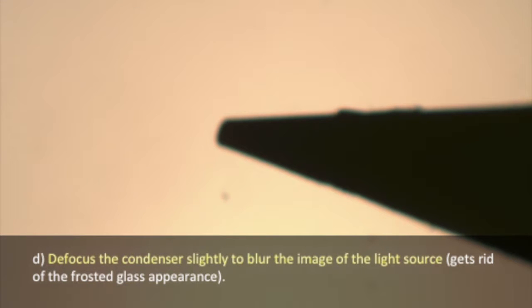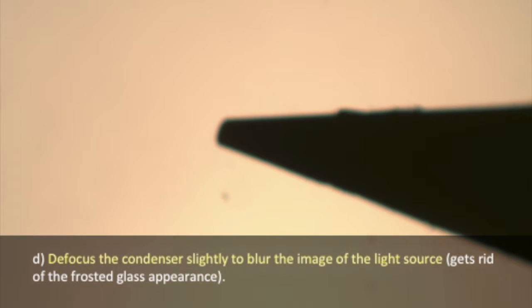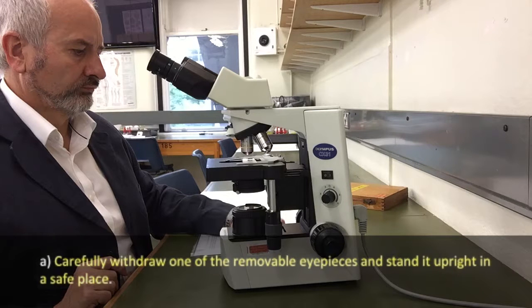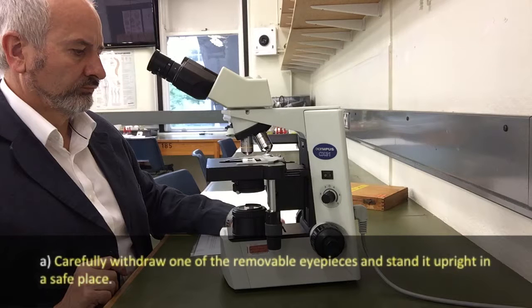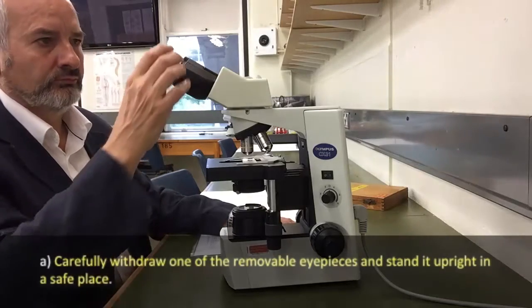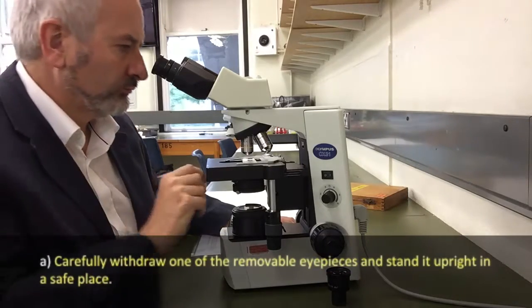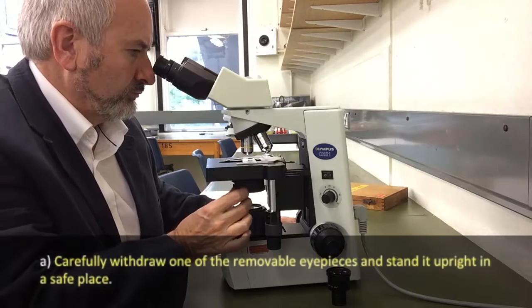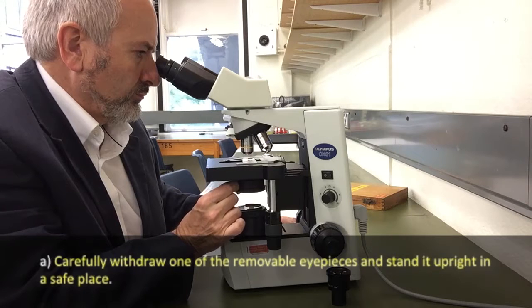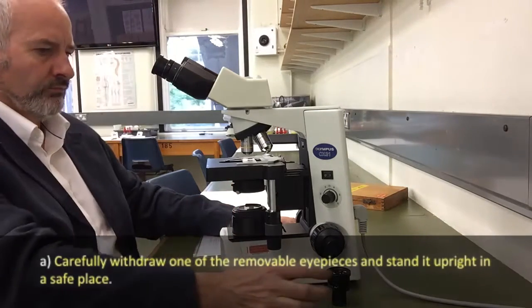The tip of the pencil will initially appear out of focus; by moving the condenser you can bring it into sharp focus. Having done that, defocus the condenser very slightly to take the pencil just away from being sharp. Finally, we come to adjusting the substage iris diaphragm to optimally illuminate the specimen. Carefully withdraw one of the removable eyepieces and stand it upright in a safe place. Then, looking down the empty tube, close the iris diaphragm and then reopen it so that the light fills about two-thirds of the field of view. This should be done whenever you change objective lenses for optimal illumination.